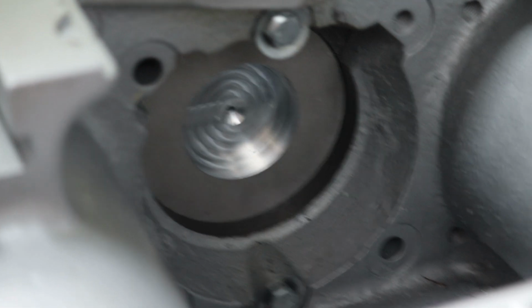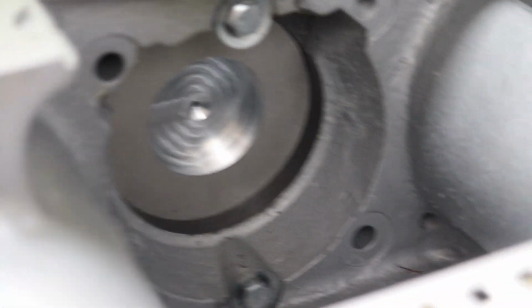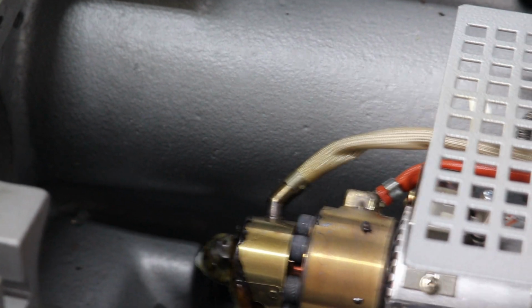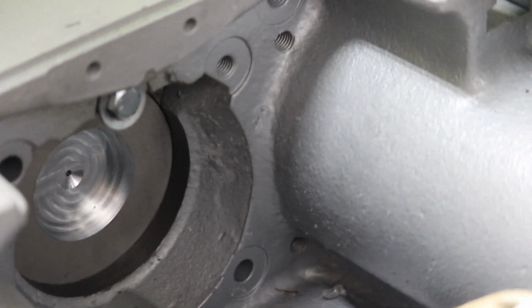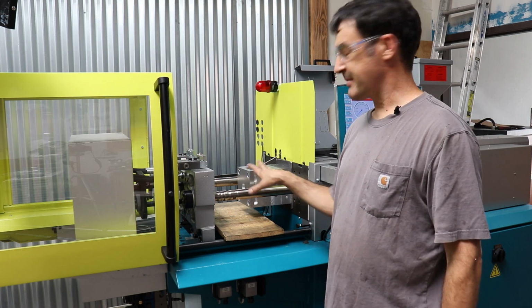Alright, so this is the setup. You can see that's the top of our mold sitting in the reference ring in the back of the molding machine, and then we've got the two bolts that are holding it against the A side of the molding machine platen. And then over here, that is the nozzle that aligns with the input nozzle of the mold, that hole right there in the center, and squirts the plastic into the mold. So, that's it. And now I think what I'm going to do is probably do a semi-time lapse of setting up the rest of the molds.